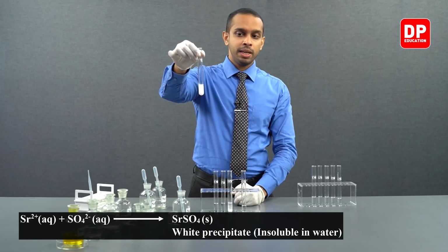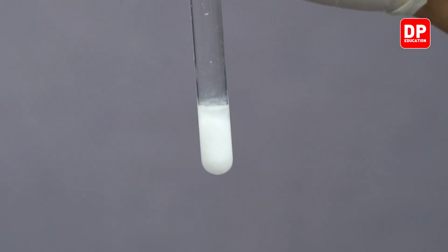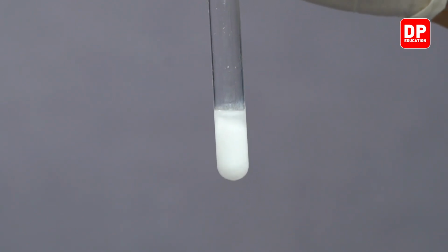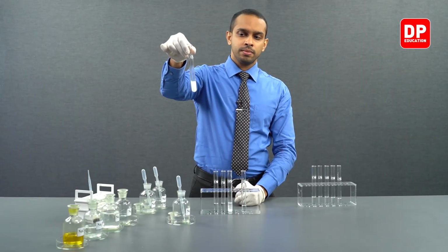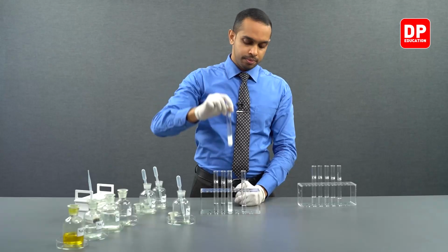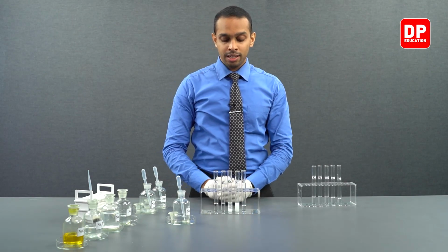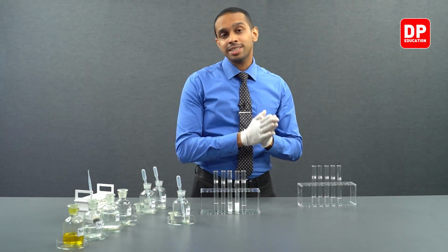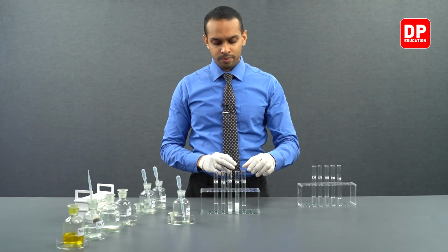This white color precipitate is insoluble in water. What we have formed here is strontium sulfate, which is a white color insoluble precipitate. So this indicates the solubility of sulfate keeps on decreasing as you go down the group 2 cations.